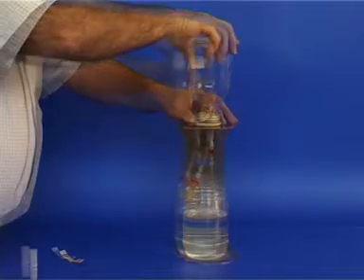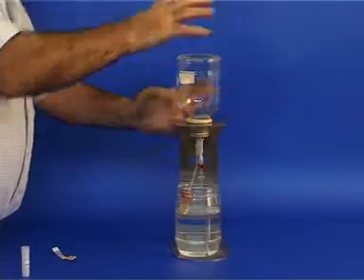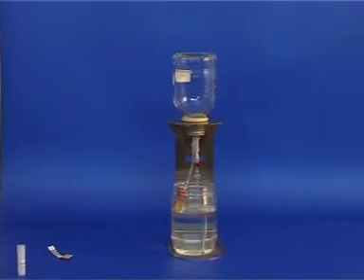Ensure that the ring passes the mouth of the bottle. We are now ready to perform the experiment.